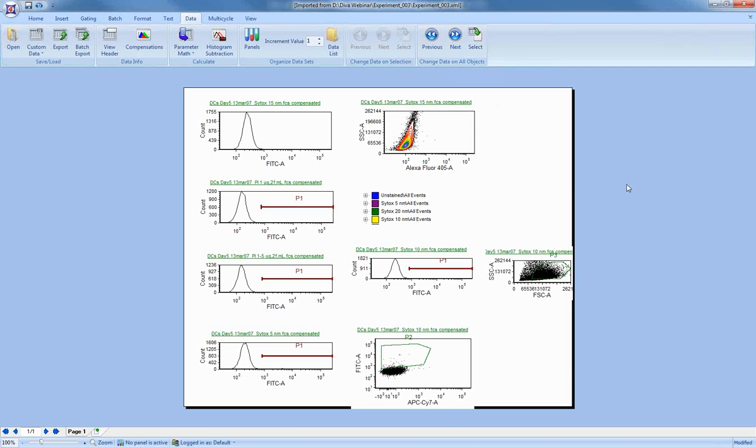Once we've got all of these, I wanted to take a closer look at the actual bi-exponential settings. As you know, one of the things that people encounter when they're using Diva is that there are values that are below 0. This is simply a scaling. It's a mathematical construct. It doesn't actually change what populations are considered positive or negative. It's just how the mathematics works in order to give you nice-looking populations, specifically when you're using compensation.